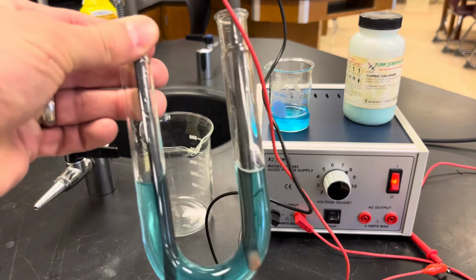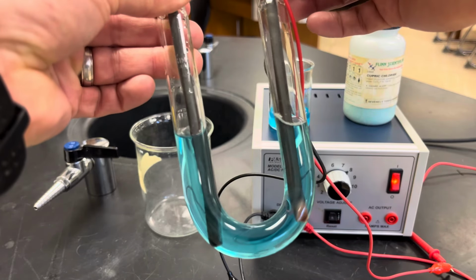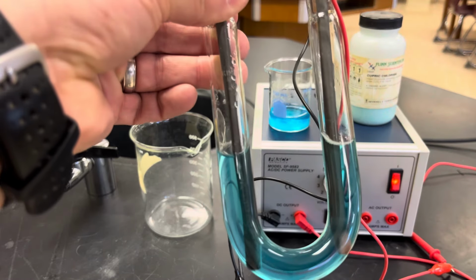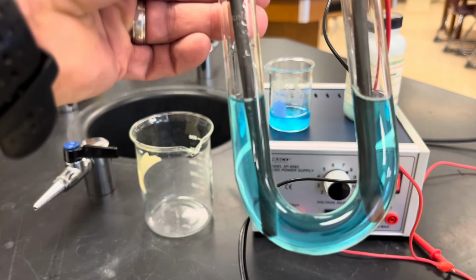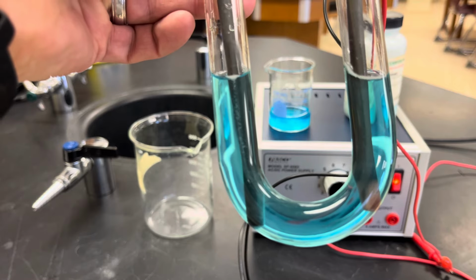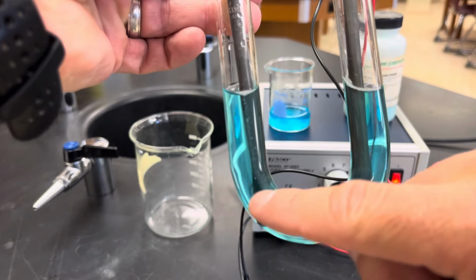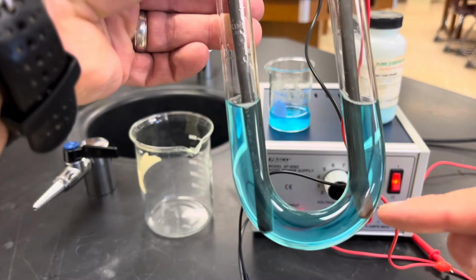And as you can see, I can see this copper. Let me try to turn it here. You can see that copper being formed on the right-hand side. And I don't know if you can see these bubbles taking place or not. It's kind of faint. You can kind of see those bubbles. Let's see if I can get a little bit closer. Start to form, okay? And you can see it's starting to get a little frothy here at the very top from these bubbles kind of coming up and hitting the front part here, and we can see the copper.